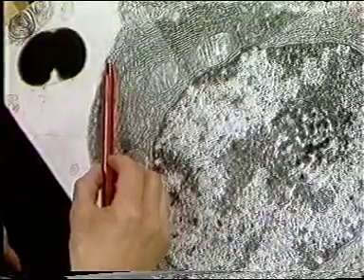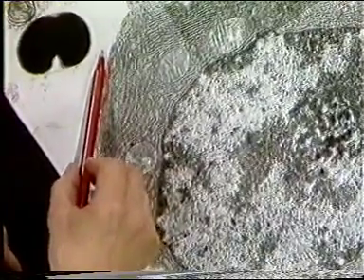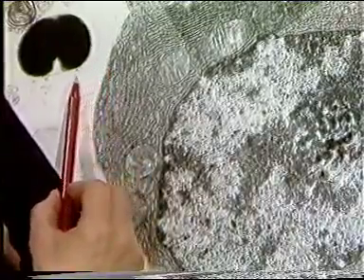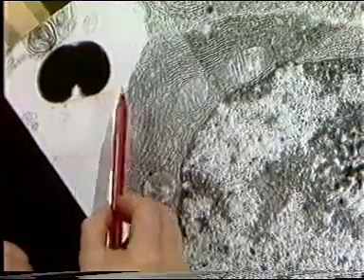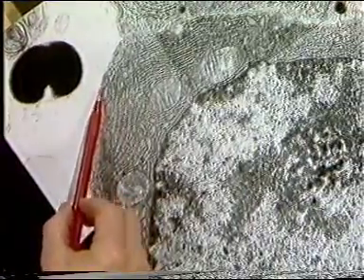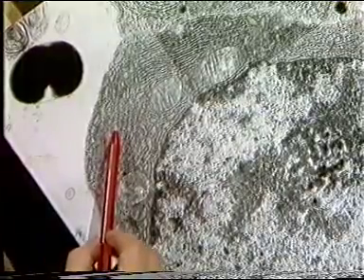This is the basal membrane, and beneath it, the light area, is the area which contains blood vessels and connective tissue. This dark structure is probably a red blood cell. Here is the basal membrane again, and what appears to be an extensive rough endoplasmic reticulum. If we go in and look at this at higher magnification, you can see a number of dark blobs along the surface. These are ribosomes, which indicates that this cell has got a considerable synthetic capacity.